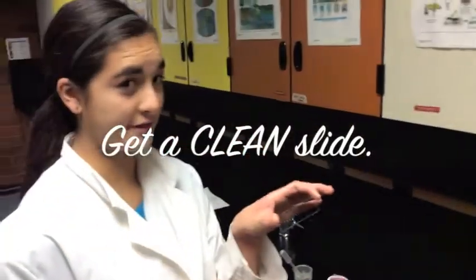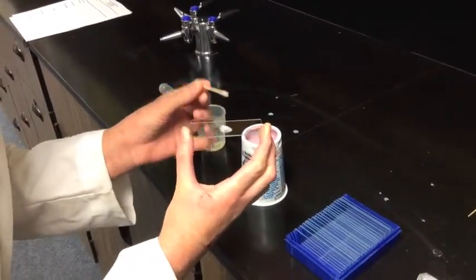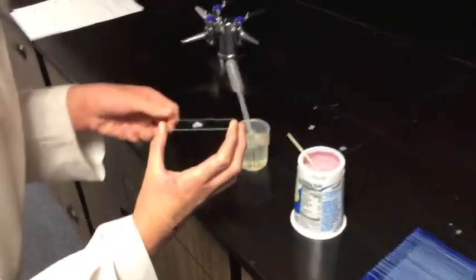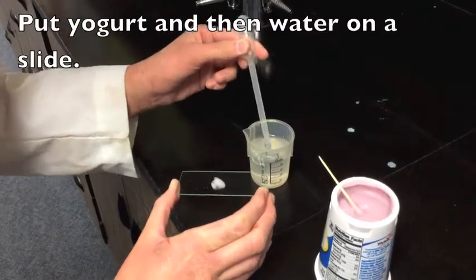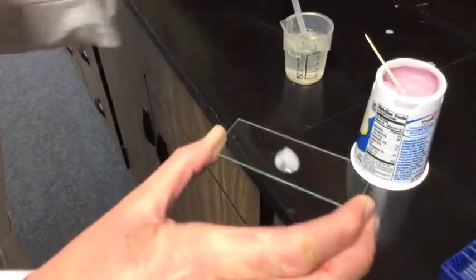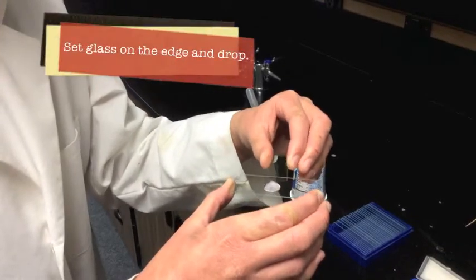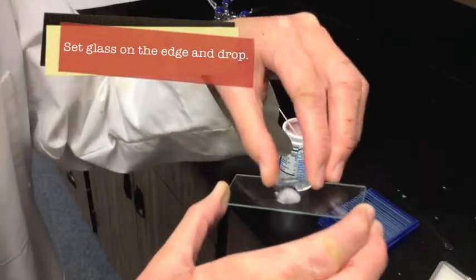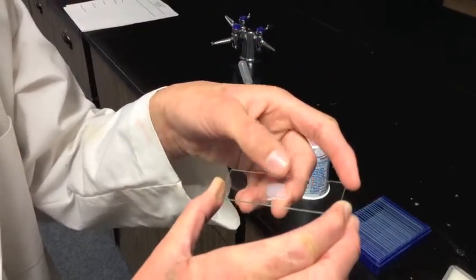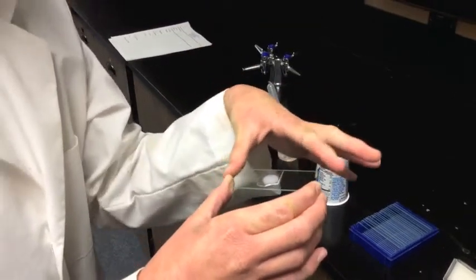Get the slide and make sure it's clean. For the yogurt, just get a small amount onto the slide — it doesn't need to be a huge amount. Then add a little bit of water, just enough to cover it. Then take a glass cover slip, place it at the edge, and drop it over so all the bubbles go out. Be sure to angle it and drop it over so you don't have bubbles interfering with your observations.